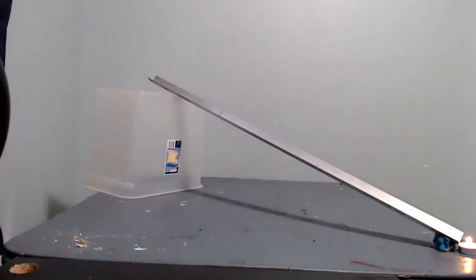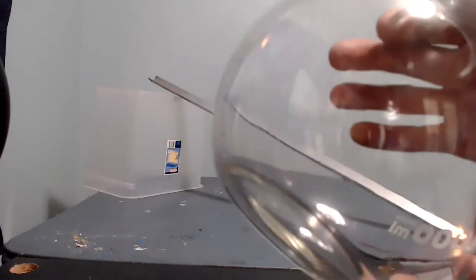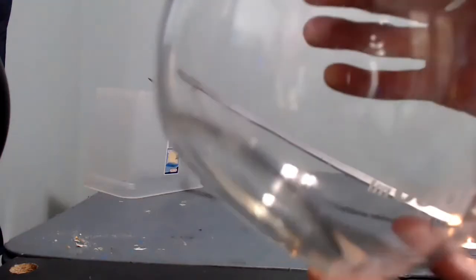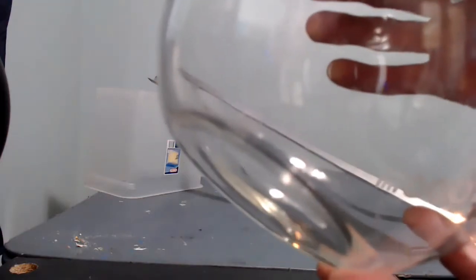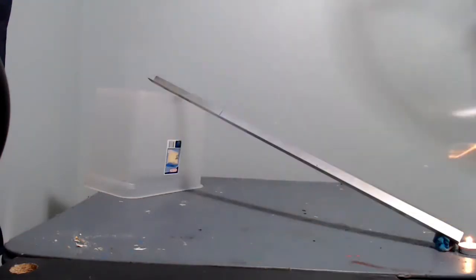Okay, now wait a second - you can't pour a gas? Well, you can if it's heavier than air, and hexane vapor here, this gas, is heavier than air so you can pour it. Okay, so I'll turn off the lights and do this.